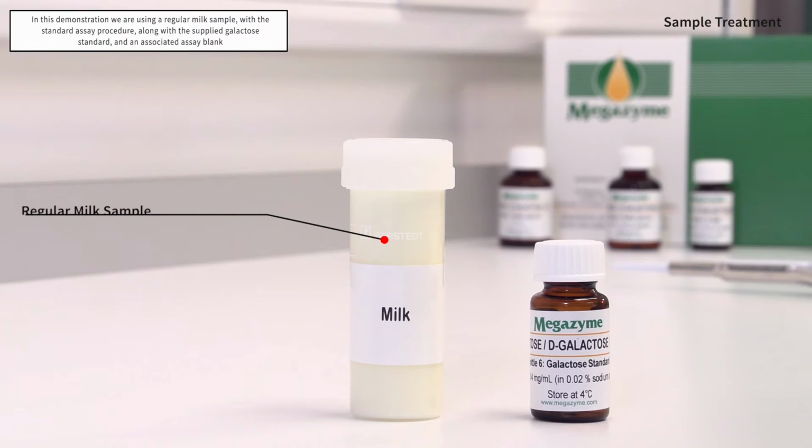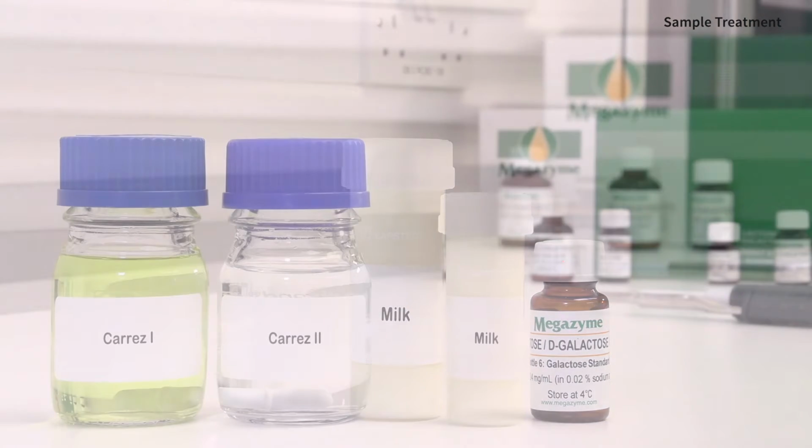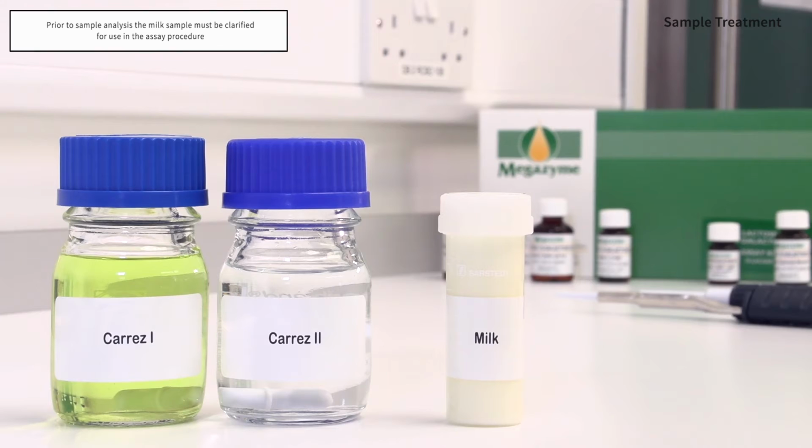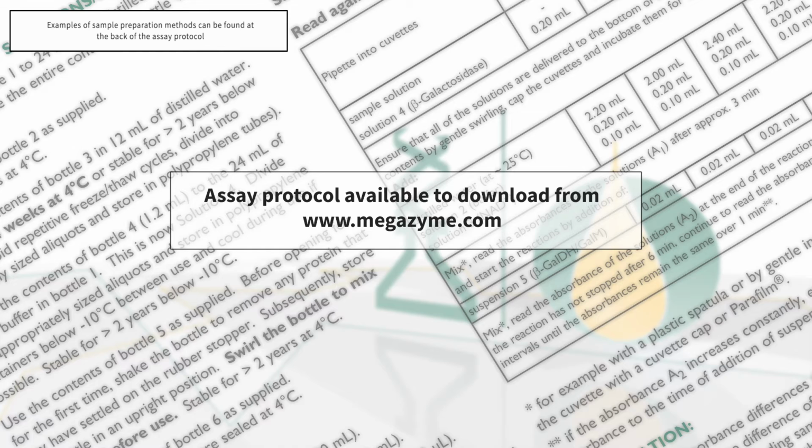In this demonstration, we are using a regular milk sample with the standard assay procedure, along with the supplied galactose standard and an associated assay blank. Prior to sample analysis, the milk sample must be clarified for use in the assay procedure. Examples of sample preparation methods can be found at the back of the assay protocol.